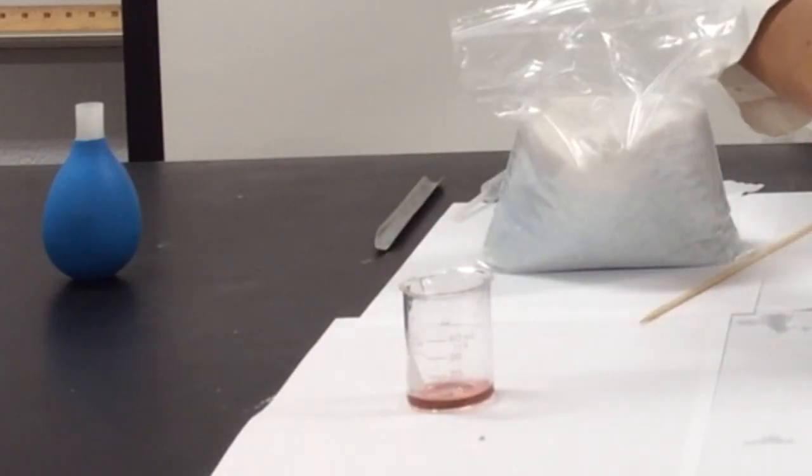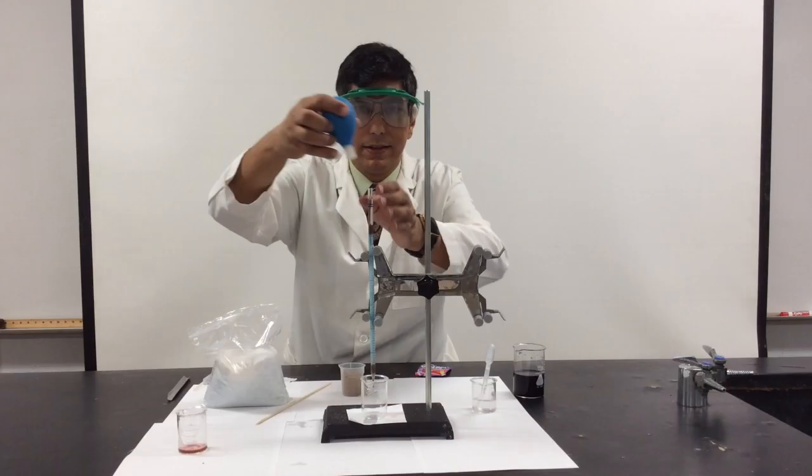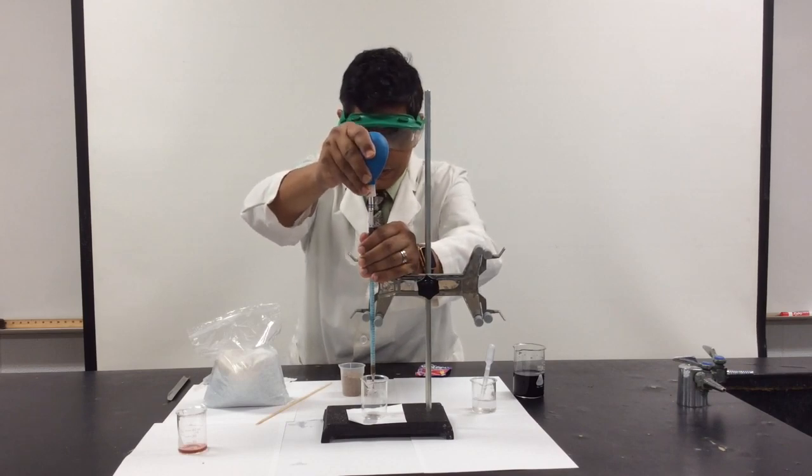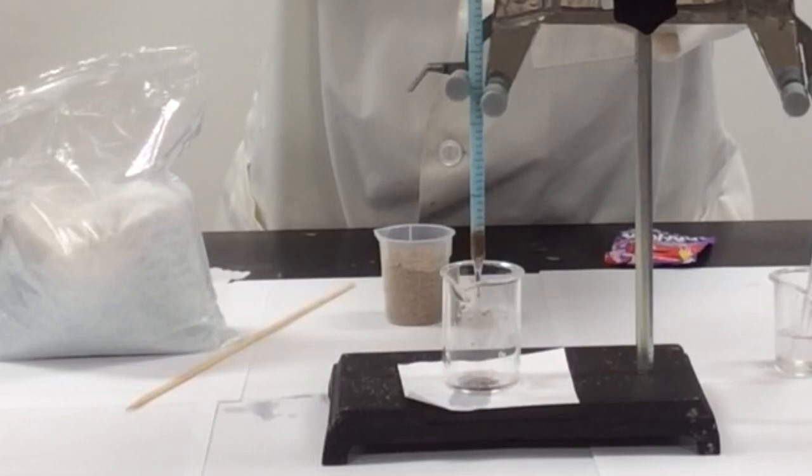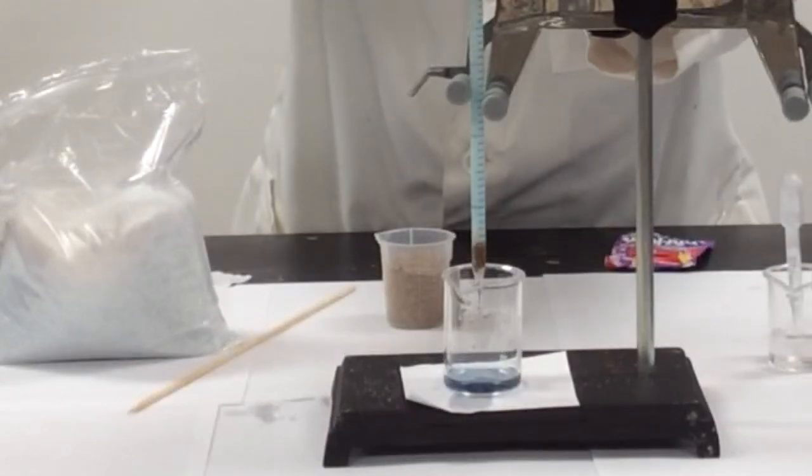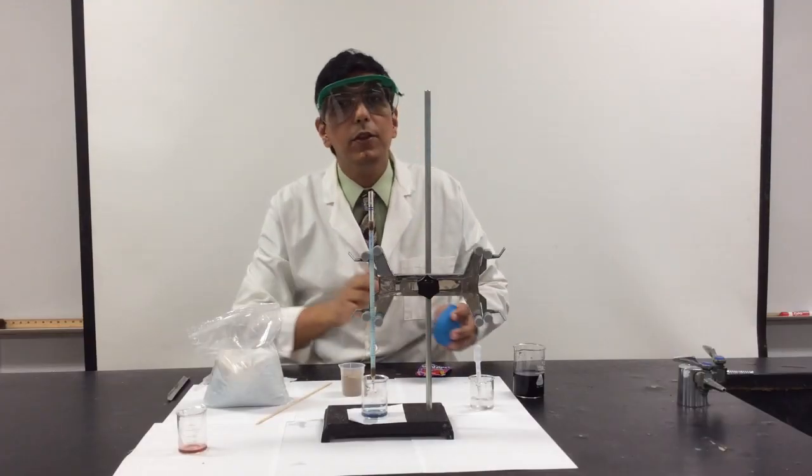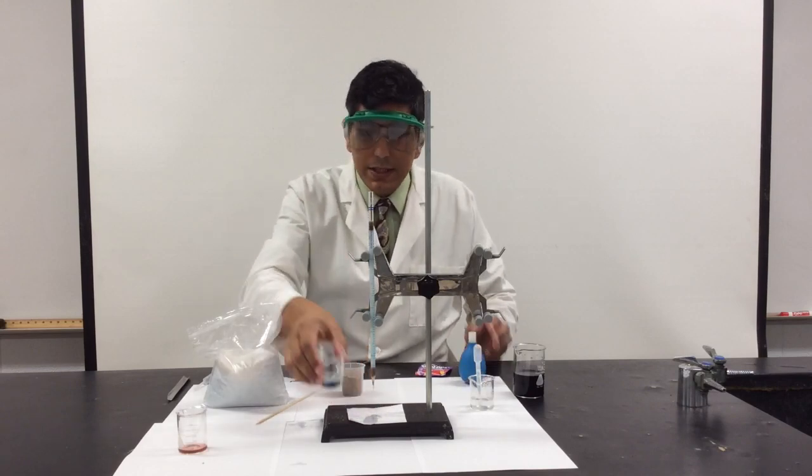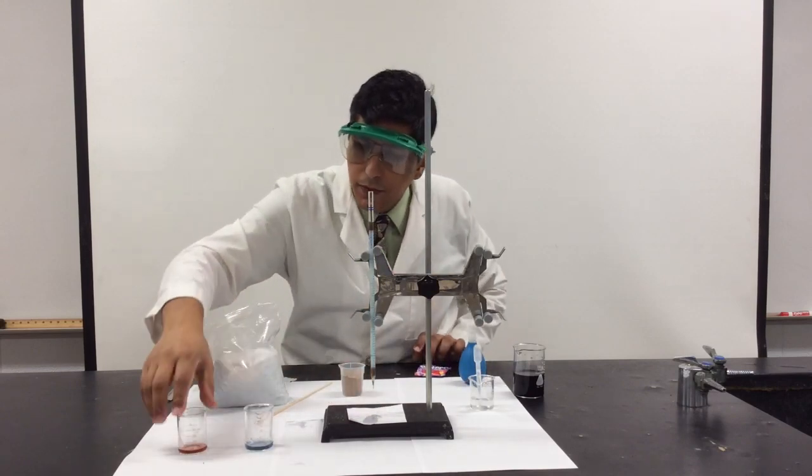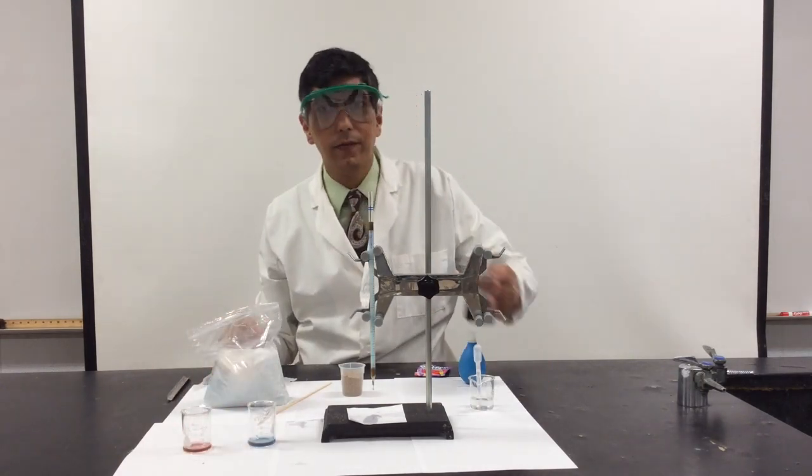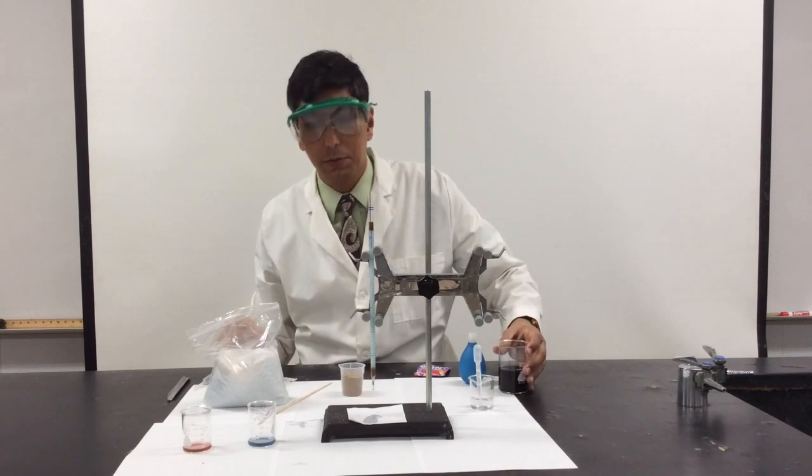I'm going to start separating out the blue dye. Or isolating the blue dye, rather. And so even though there's still some blue dye in the column, we can safely say that we have separated the red from the blue dyes in the solution of grape Kool-Aid.